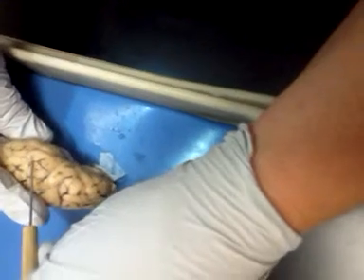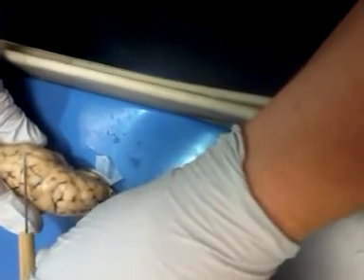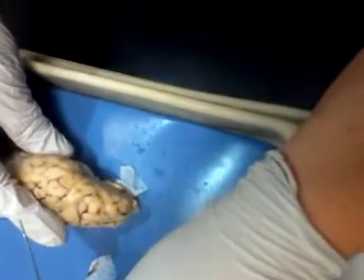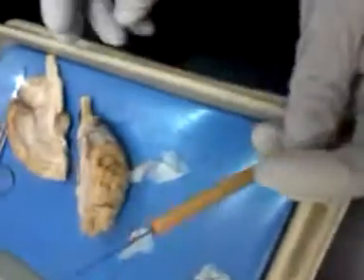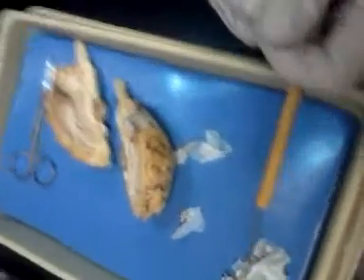And that's what I was talking about here, is if I were to stick this probe kind of underneath, see the clear, that's your pia mater, okay? Oh, it's like shrink wrapped. That's how they would ask. It would be like that. They usually don't have it. Okay. This one though, you can bet they'll ask about it.